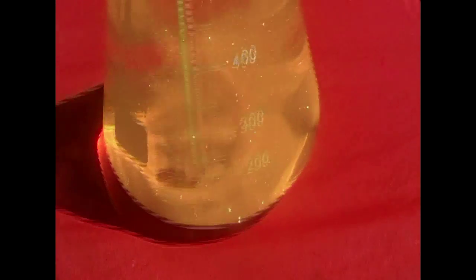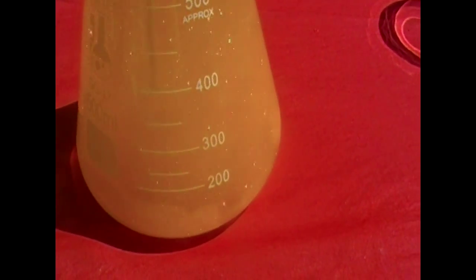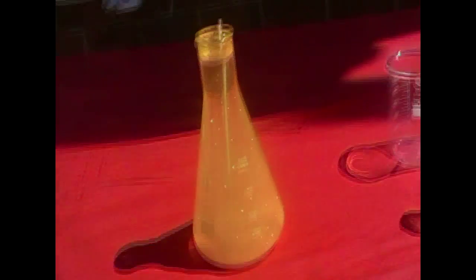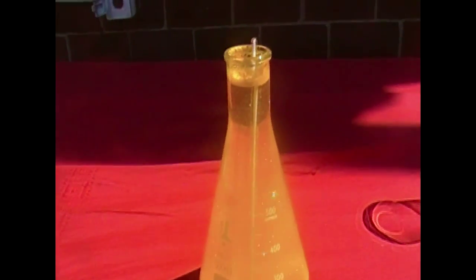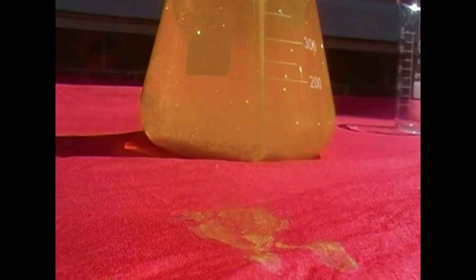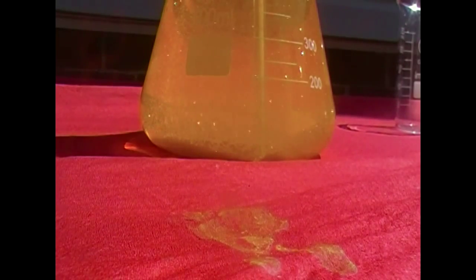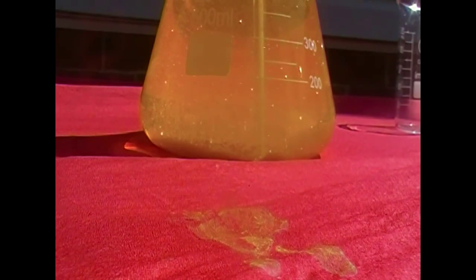As you can see in this take here, you'll be able to see all of the crystals cool down at the bottom. This is the day after I did the experiment. This is the next day when it fully cooled down. So you'll be able to see how much it glimmers, because I did it early in the morning when the sun was finally out, so it looks absolutely beautiful. Now, unfortunately, you can see at the top, at the neck of my Erlenmeyer flask, that a lot of lead iodide precipitate that hasn't been able to dissolve completely has stuck to the neck of the flask, and that's not very good, so I have to go wash that off as soon as possible. But that's my problem and not yours.